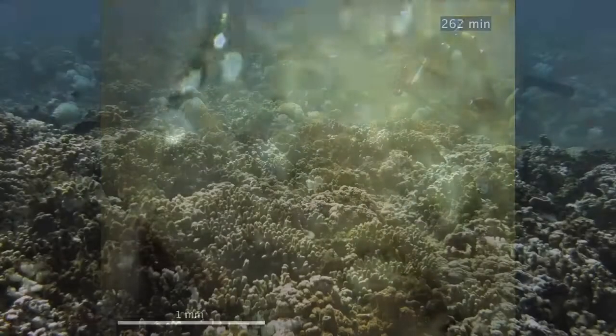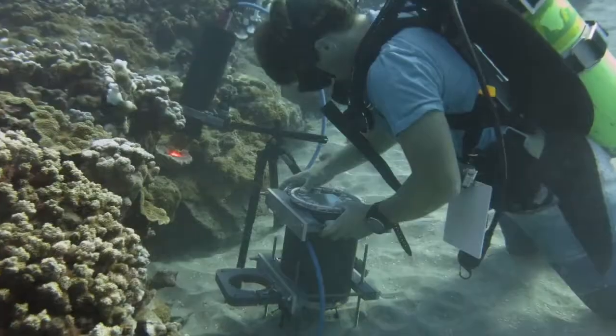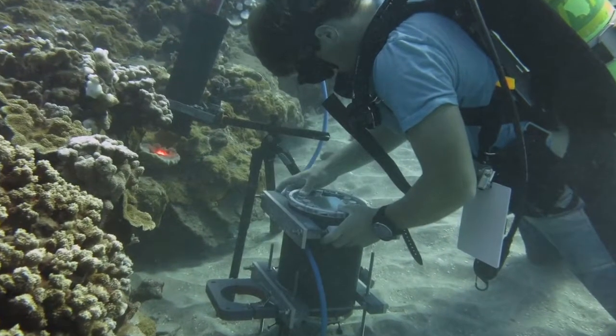And so we introduced corals nearby each other, and then we used the instrument to look at those interactions. You can see one of the polyps starts emitting its mesenterial filaments, which is basically its gut, and so it's digesting the other coral next to it. People have studied this at large scales in the field and potentially small scales in the lab, but no one has been able to look at these small scales in the field before.